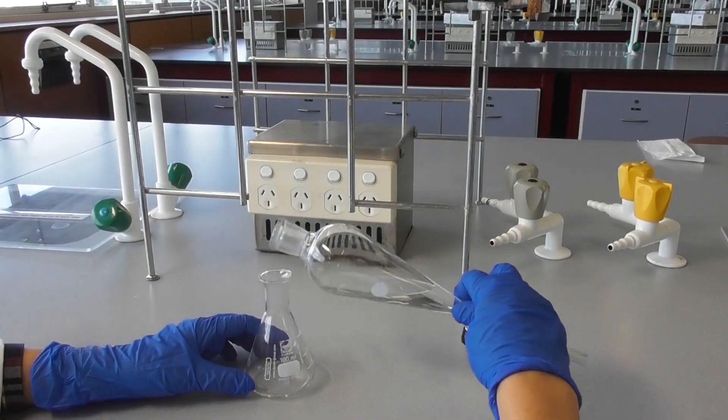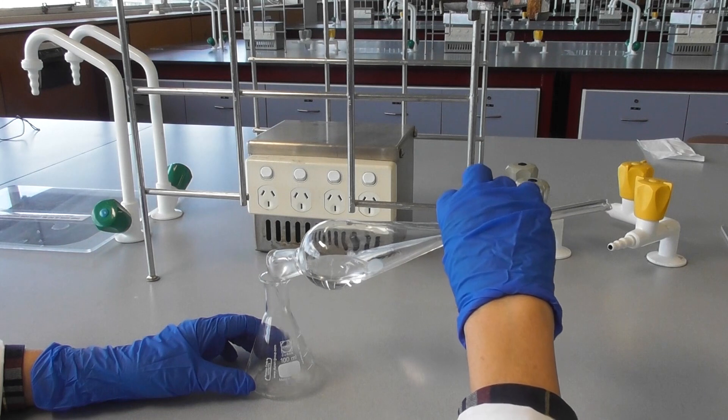Decant the top layer into a flask. Do not run this layer through the tap.